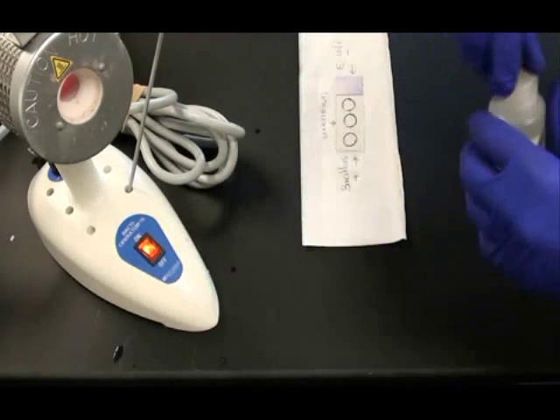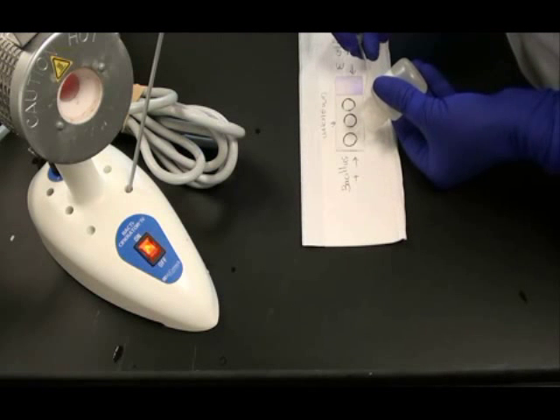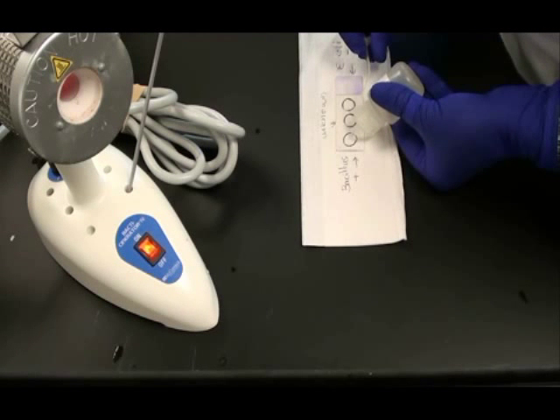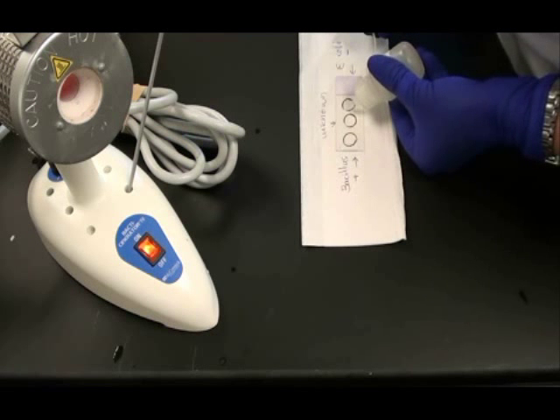I'm going to put a drop of water in each of those circles. I will use this water to mix my bacterial samples into.